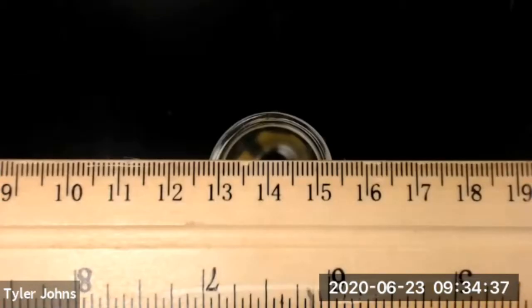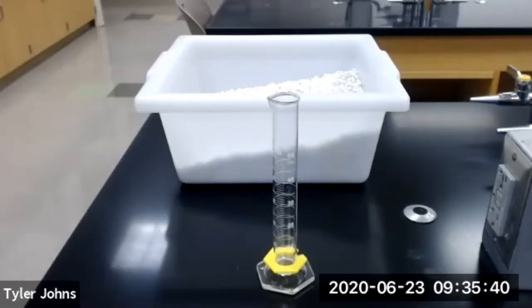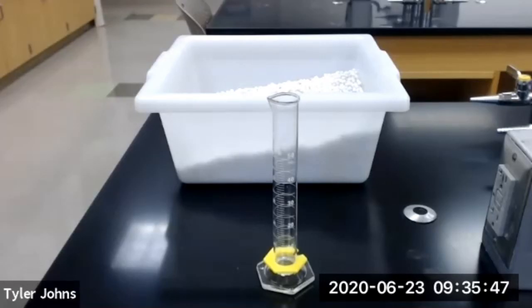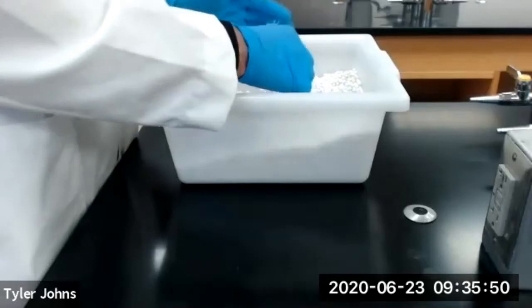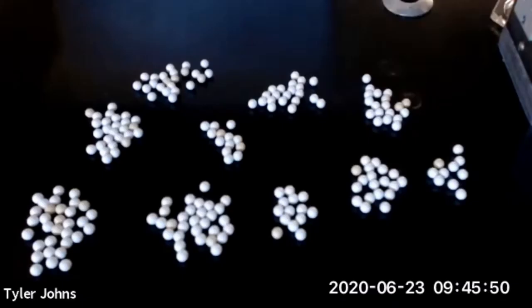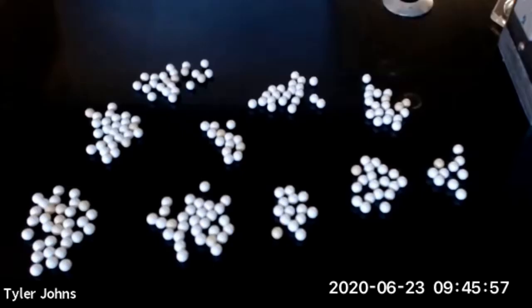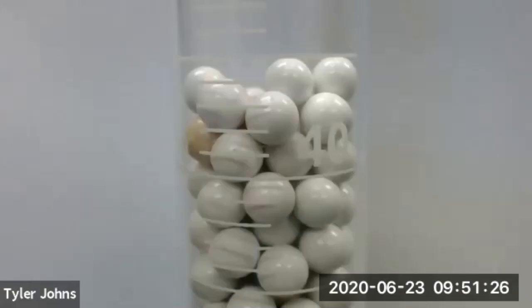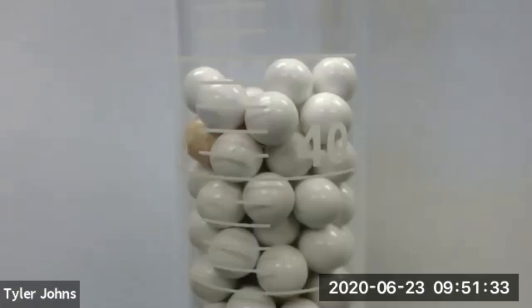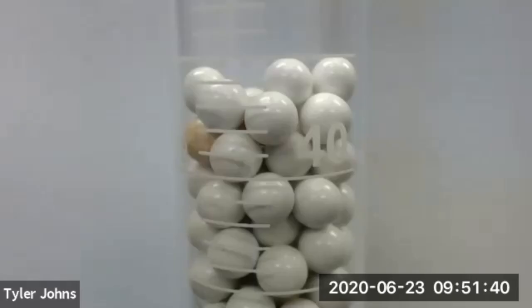This is the inner diameter of our 50 milliliter graduated cylinder, cylinder A. We next need to fill our 50 milliliter graduated cylinder at least halfway full with BBs. This is the number of BBs within the 50 milliliter graduated cylinder or cylinder A, and this is the total volume occupied by BBs in cylinder A. You can now calculate the diameter ratio and the packing efficiency for our 50 milliliter graduated cylinder.